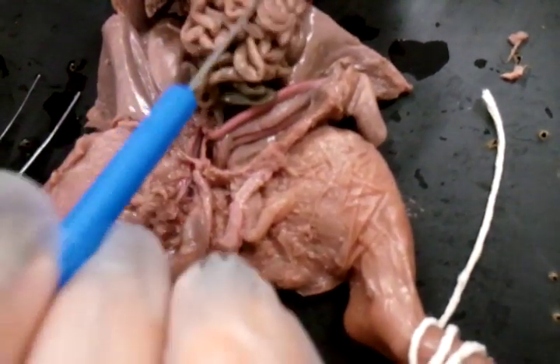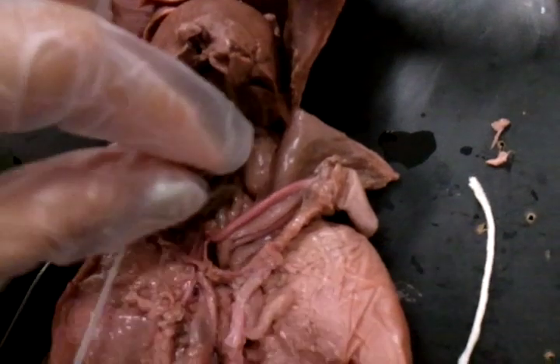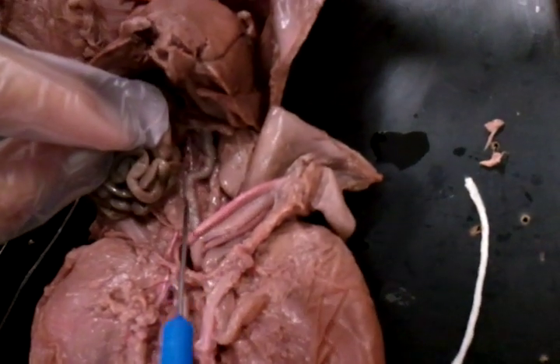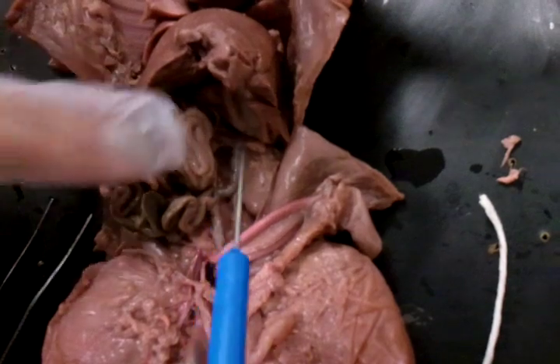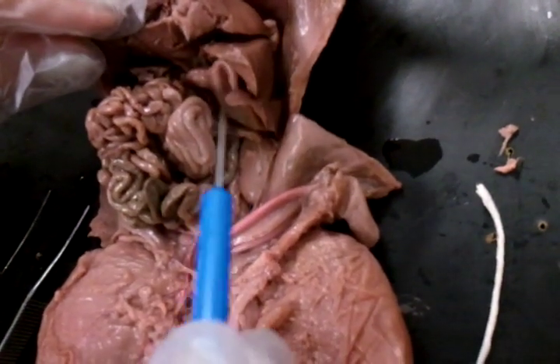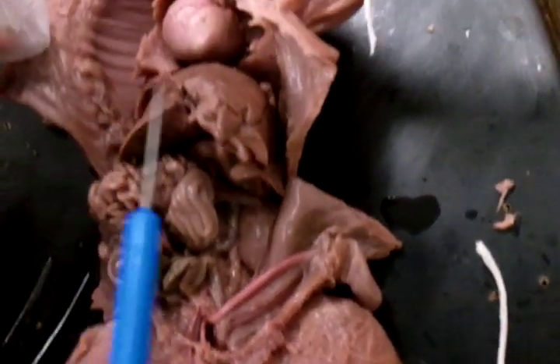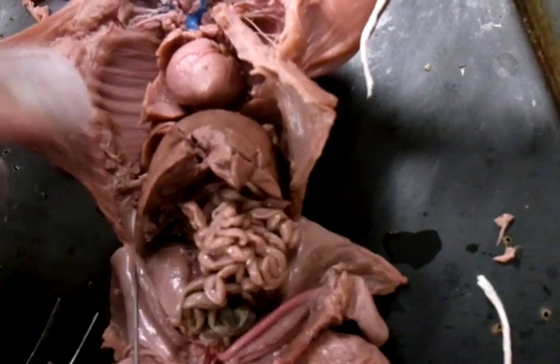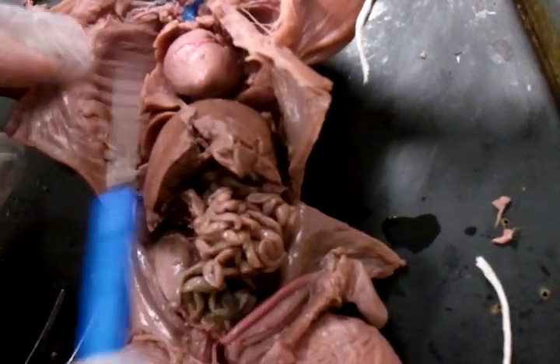Then we're gonna do small intestine. And this is the large intestine, also the colon. Stomach. Gallbladder, liver.